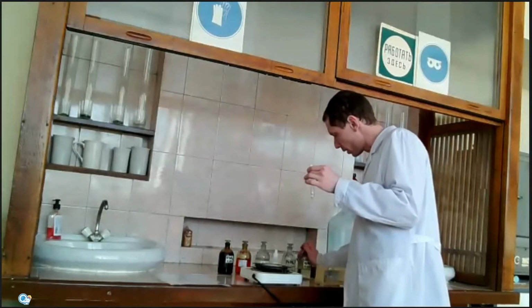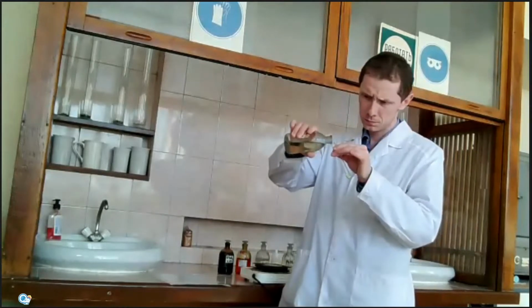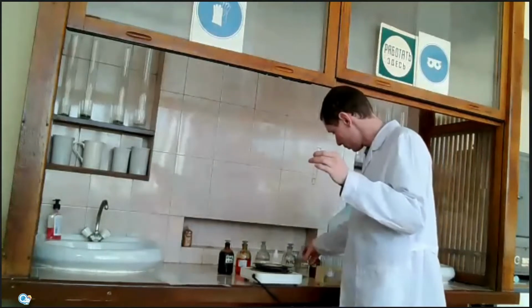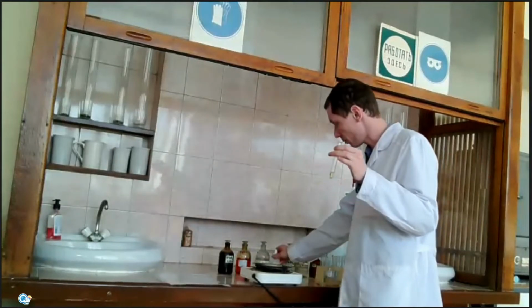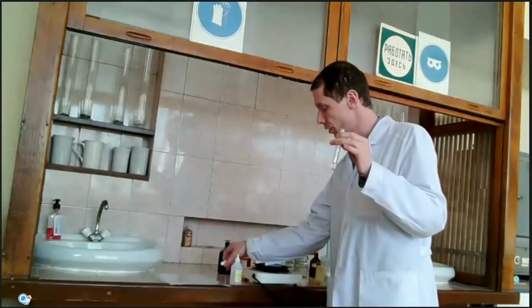Also, we should add sulfuric acid as a condition. And then we will add a few drops of hydrogen peroxide.